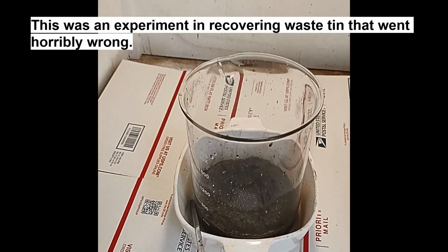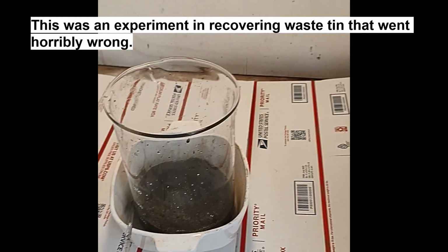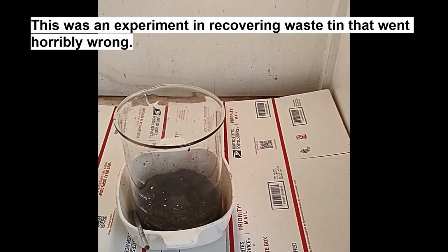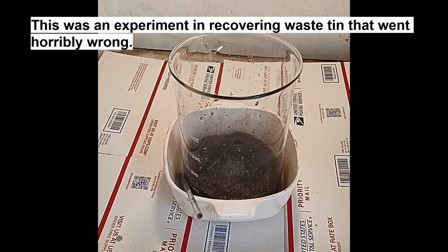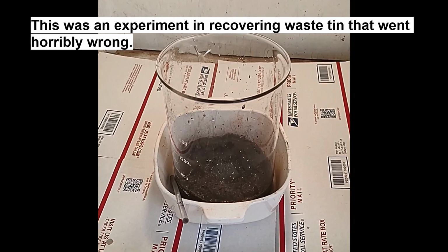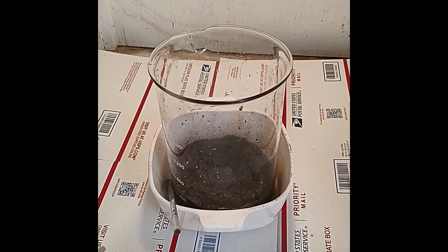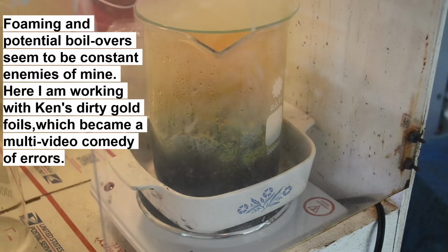Whew. Okay, got everything out of the fume hood. I'm in the process of cleaning all the glassware and hot plates that got spattered. I got the reaction into a much bigger beaker where it can't boil over anymore, but it is still going. I'll explain what's going on in a future long-form video.